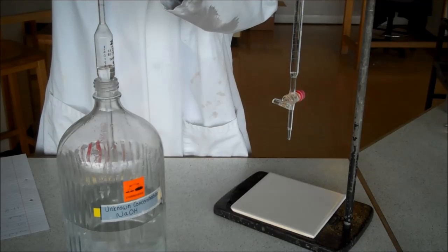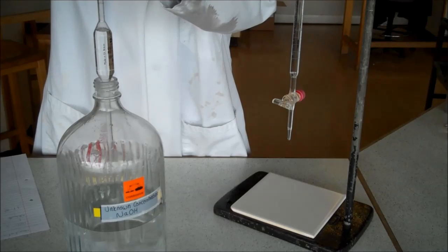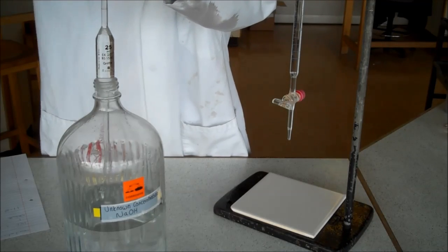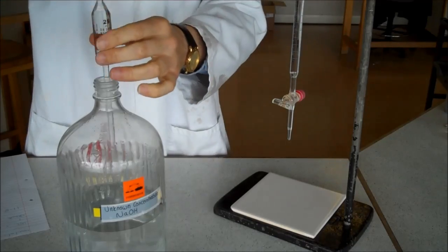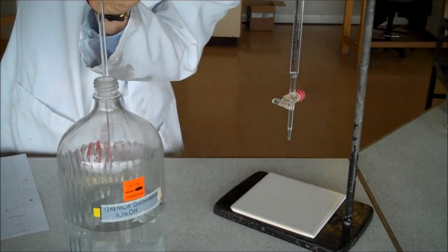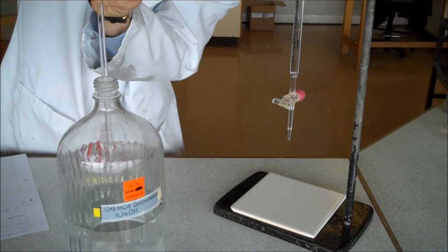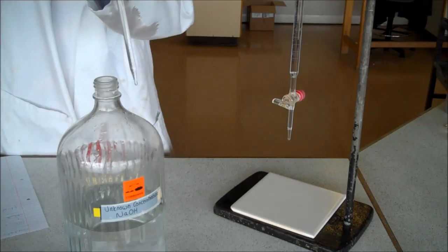You won't be able to see all of this as I do it, but we're measuring out, we're sucking up exactly 25 centimetres cubed of our alkali. I've gone over the line, so I'm just letting a bit of alkali out. The alkali is exactly on the line.